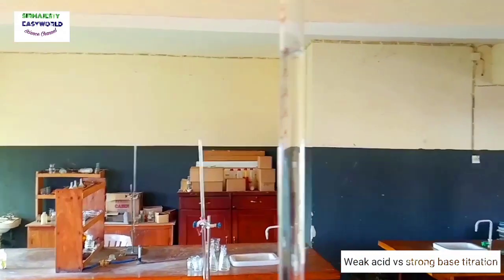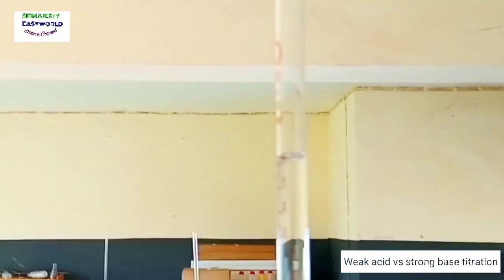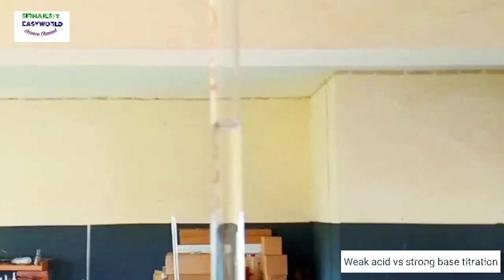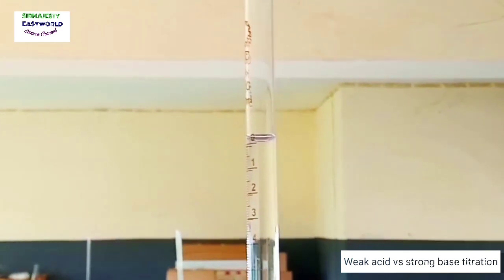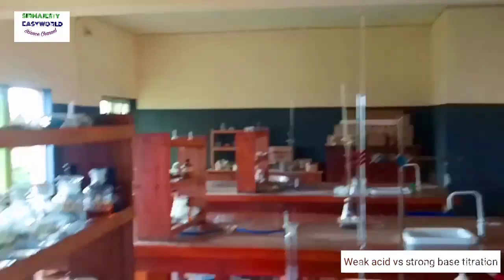You can see the initial burette reading is on the 0.00 mark. So we go back and start the titration.